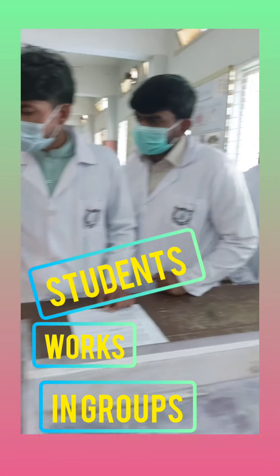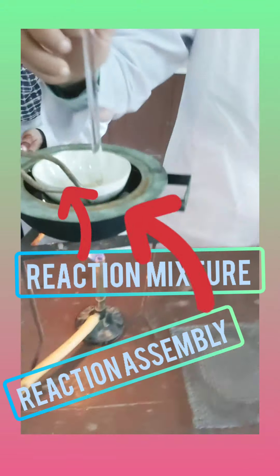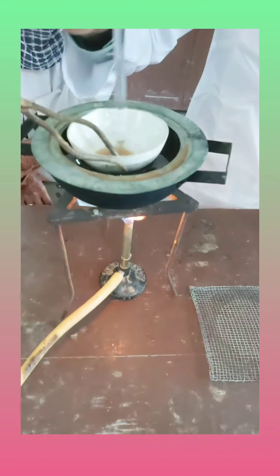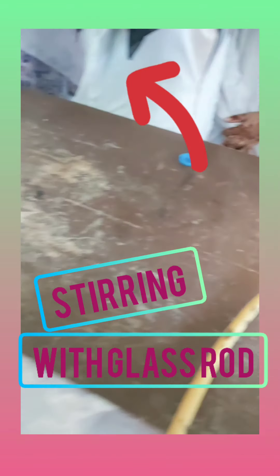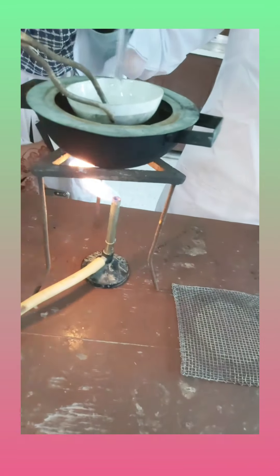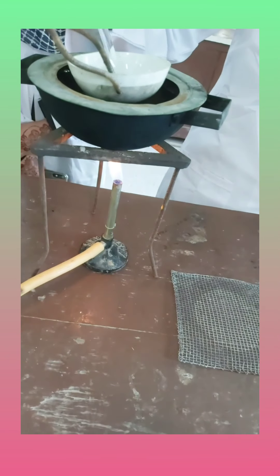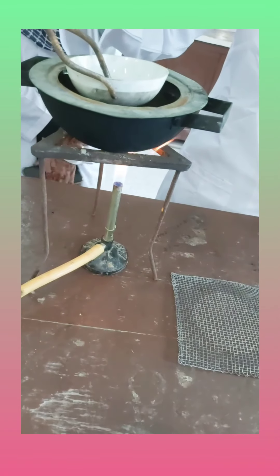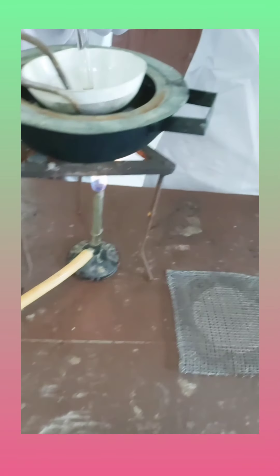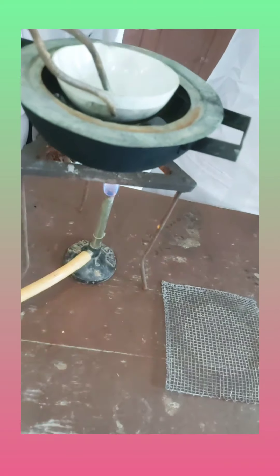These are my students working right now — they are preparing a Schiff base, an organic compound. Girls are also standing here. I'm showing the work and how they have arranged the assembly for the whole experimental process. A Schiff base is formed when you simply react an aldehyde or carbonyl compound with an amine. This is what they are doing — stirring the compound, which is called slow stirring.